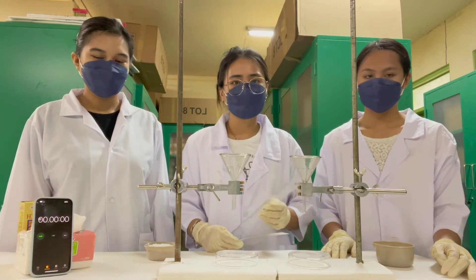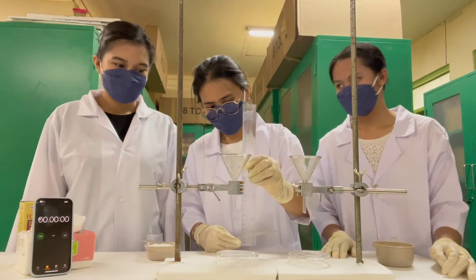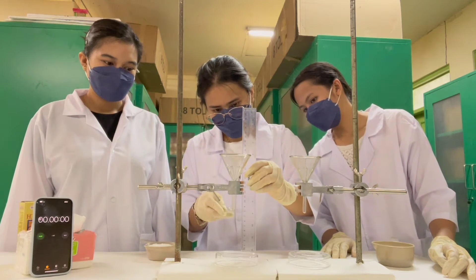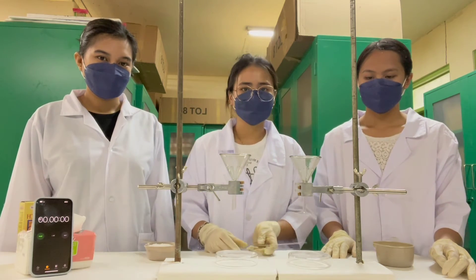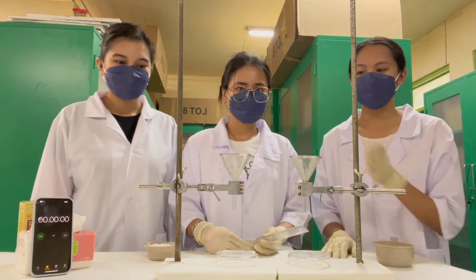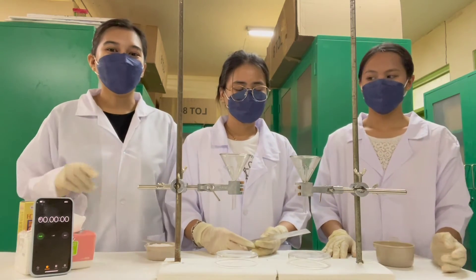In measuring these two funnels we have to make sure that they have the same height. For this funnel too we have 8 centimeters.